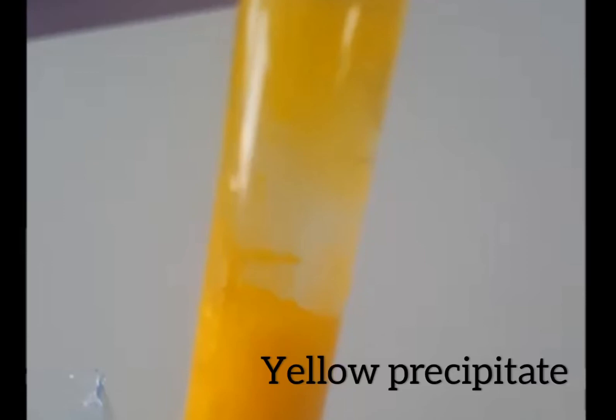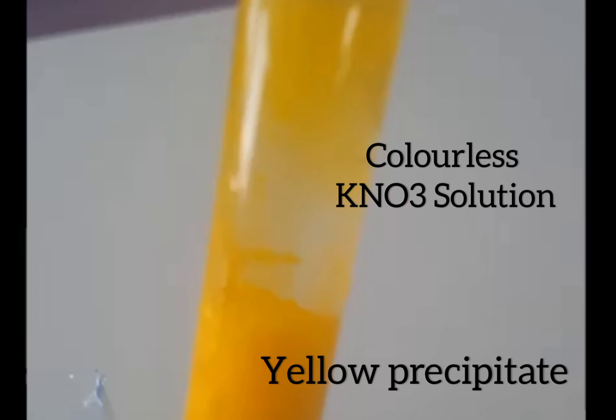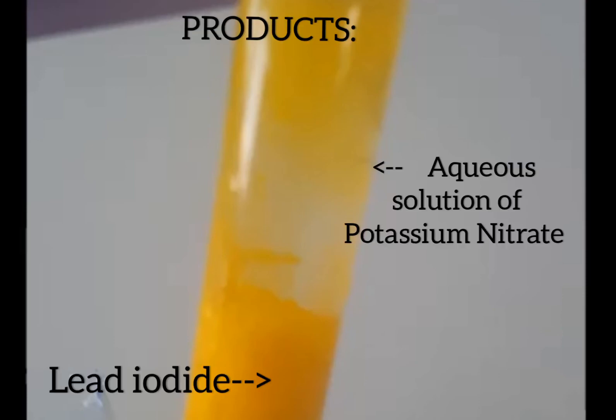I have taken out the test tube so you can see very clearly that the yellow precipitate has settled down and the colorless solution is on the upper layer. This colorless solution is potassium nitrate, which is soluble in water and therefore forms an aqueous solution. These are the two products obtained from the reaction between lead nitrate and potassium iodide.